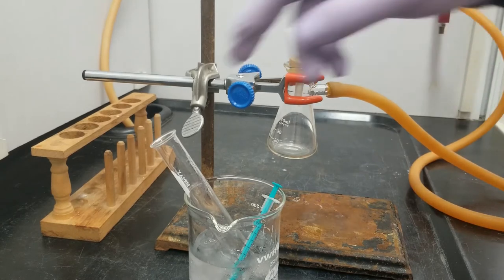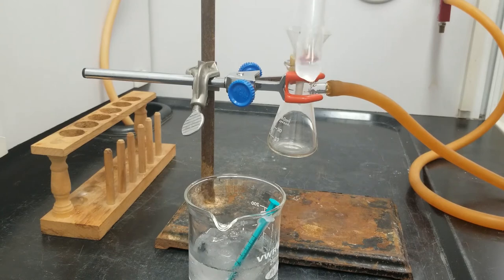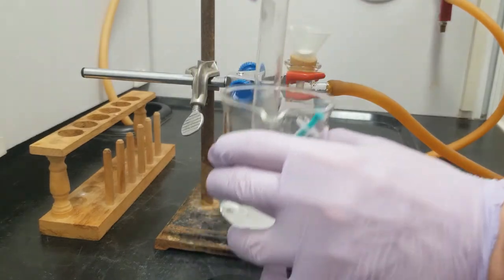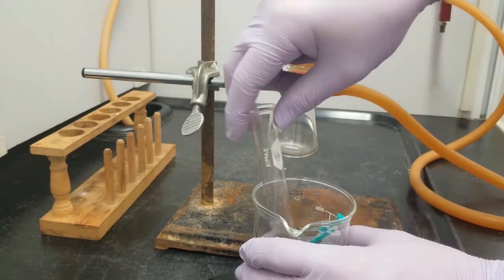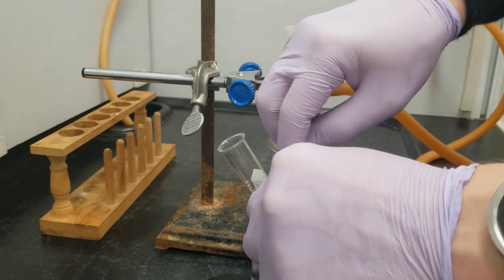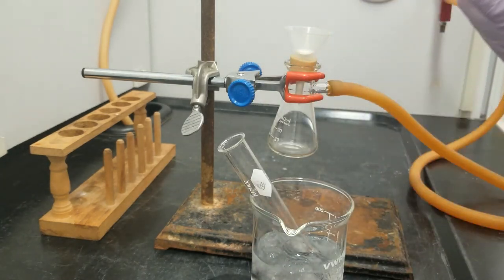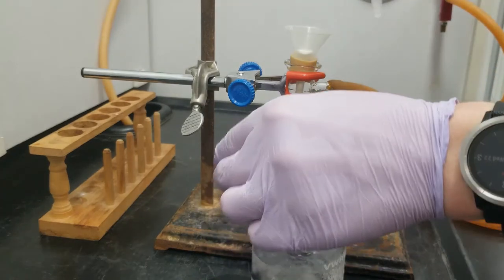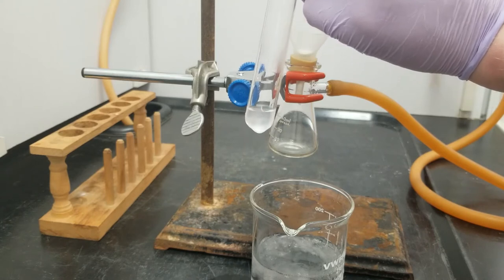Okay, so here's our reduced benzophenone reaction after that 20 minute wait time. I've also had it sitting in a little ice water bath for five or ten minutes here, just to get it nice and cold. And what I hope to see is upon the addition of half milliliter of ice water here, I would hope to see that alcohol product precipitate.